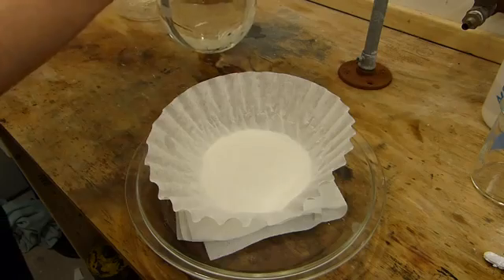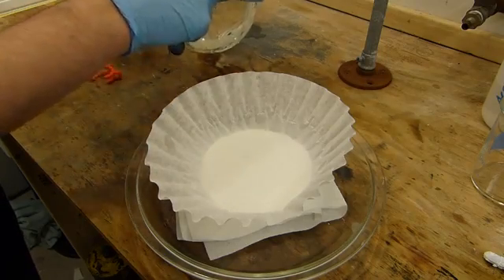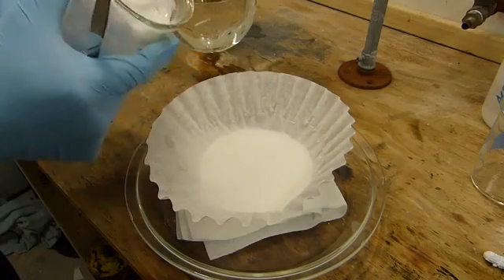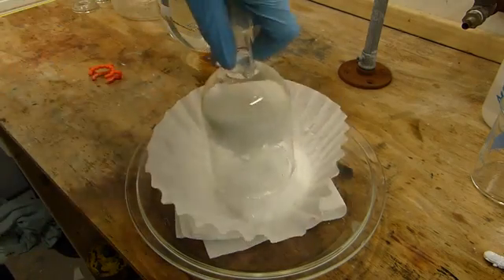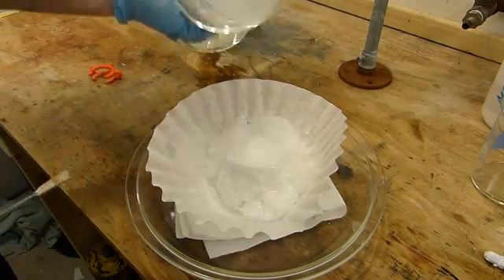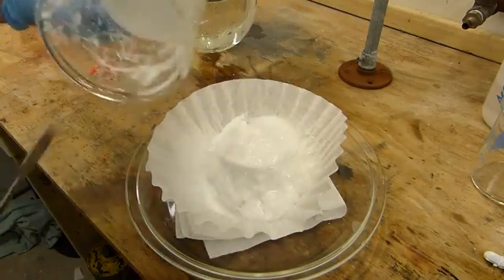Okay, and we're back to the old paper towel trick. The benzoic acid crystals. These should probably just dump out. It's fine. Good. Oh yeah, there we go. Look at that. Almost clean.